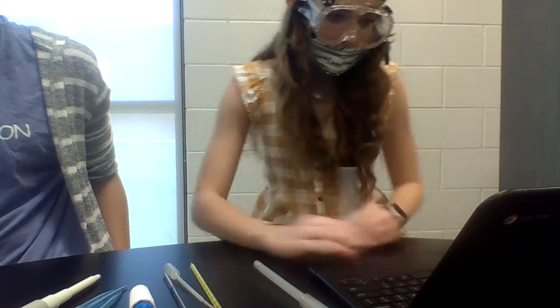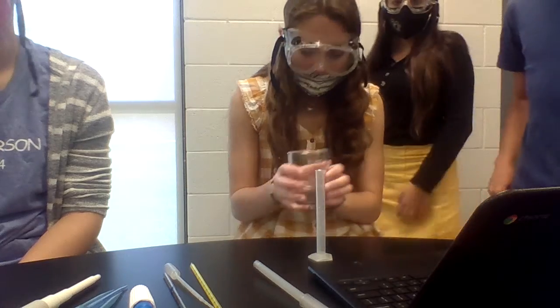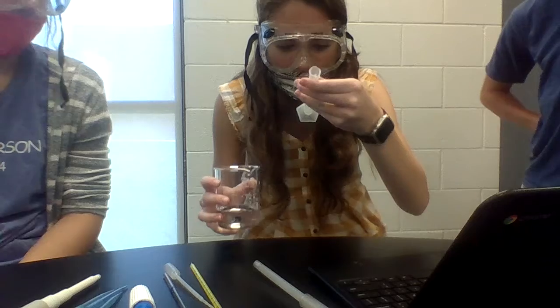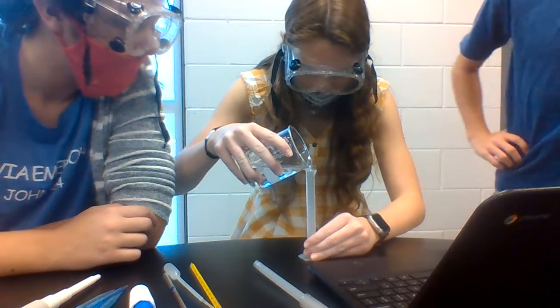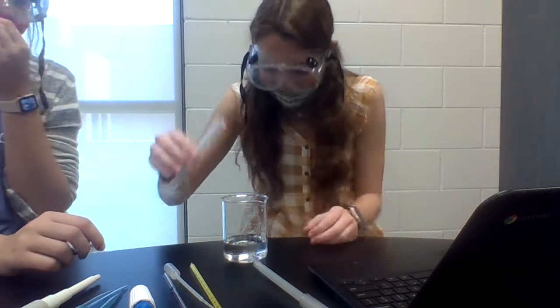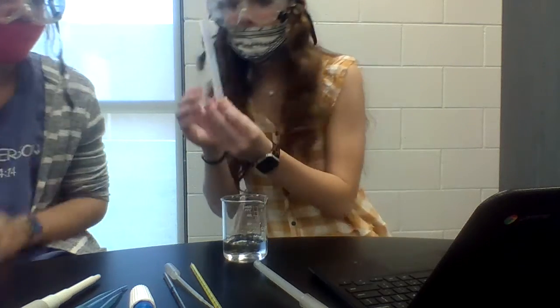Alright, and we put a 1 in there. This is the graduate cylinder. Alright, this is about to be... Using it, add 1 milliliter. I can't really see. I need my glasses. Oh, that looks like 1 right there, right? I can't see though. You don't know that it's 0.00 because... No, she told us to. Hey, that looks kind of right. Right there. That looks kind of right. Yeah, I can't really make sure.